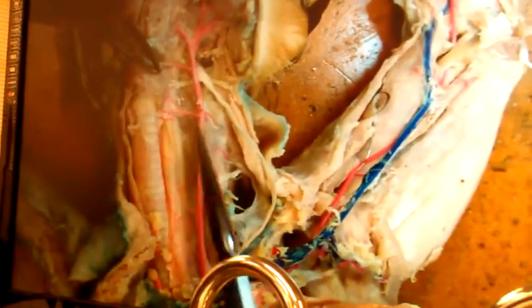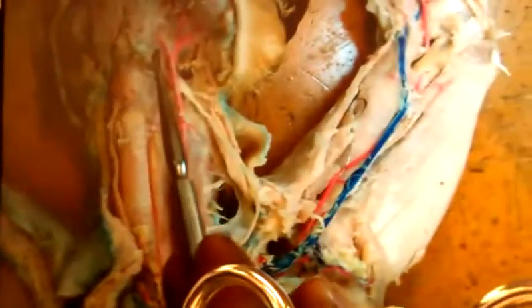If that much is true, Mr. Gilmore, I want to continue up. You'll notice this fella is going toward the what? Mr. Gilmore, what is this? That's the what? Larynx. Alright? If that's the larynx, or the voice box, well, what are you going to call the vessel that's going into it? Laryngeal. Alright, got that, Mr. Gilmore? Well, there's one, but he's going toward the tongue. So, we're going to call him lingual.